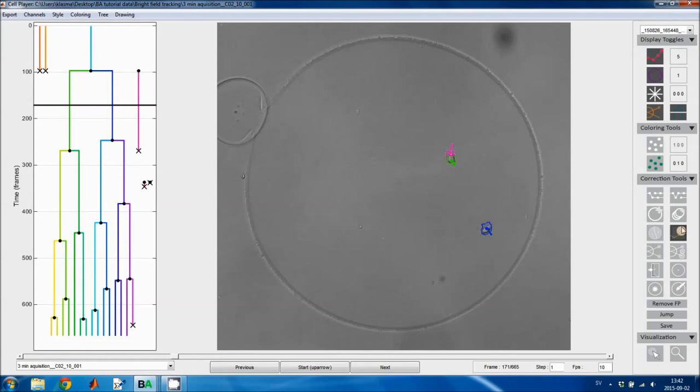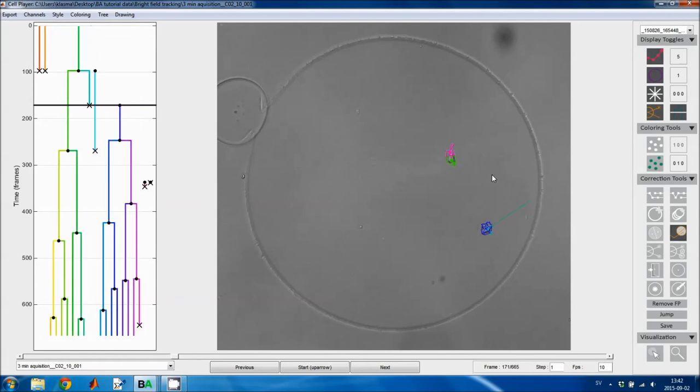The next tool lets you do the same thing, but you click on a center point in the previous image, and then you click on a cell that you want to copy. The cell that you click on will be copied from the current frame onward and linked to the partial track that you just created. So if I click here, then I link it, and I also keep the cell that I clicked on. You show it again here.